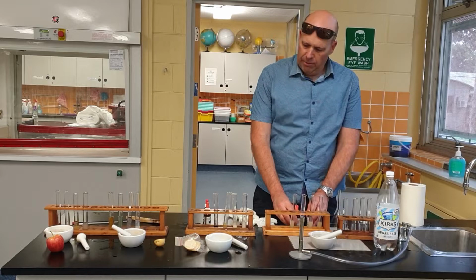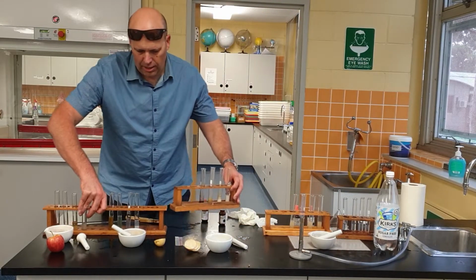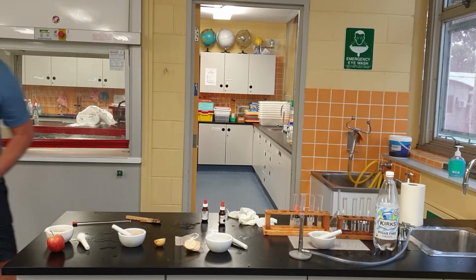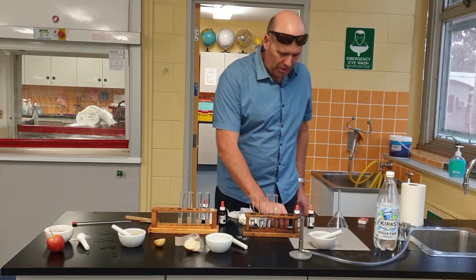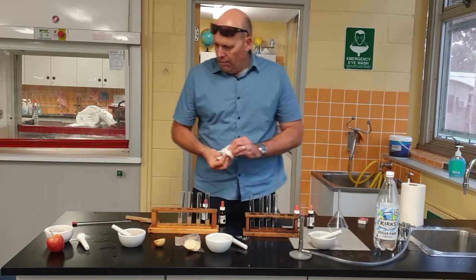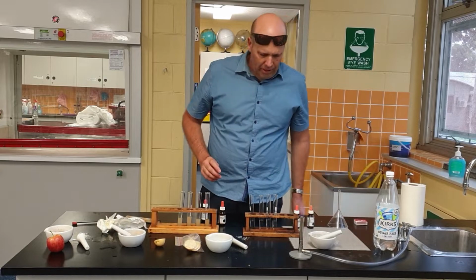All right, folks, moving right along. So we've done those three. Move them to the side. Now we've got two more to do. The next one is Chupa Chups. Chupa Chups are something that I don't eat a lot of, but I reckon they're nice.